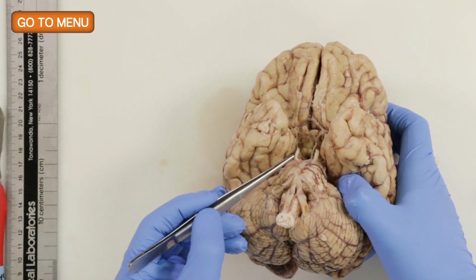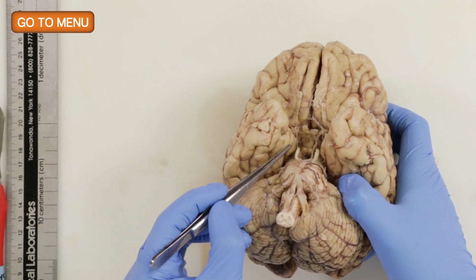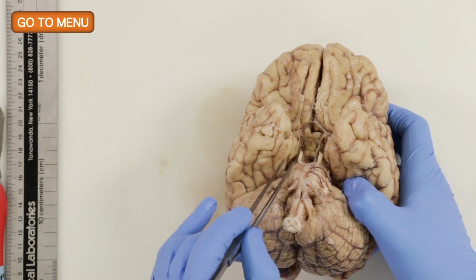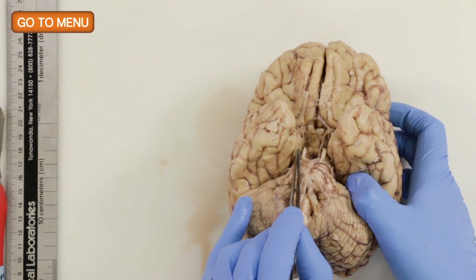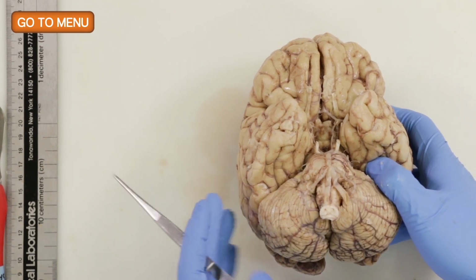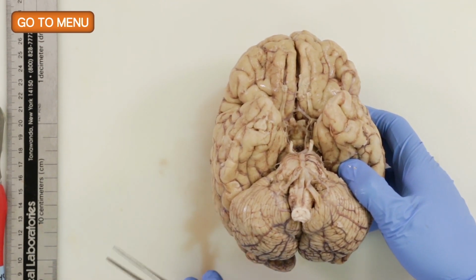And if there's a lot of edema in the supratentorial compartment, it can push this down, and you may see more prominent notching here, and it could potentially be more lateral. So in this case, it looks normal on both sides. So there's no evidence of uncal herniation.